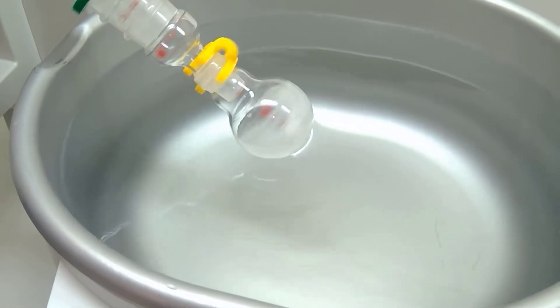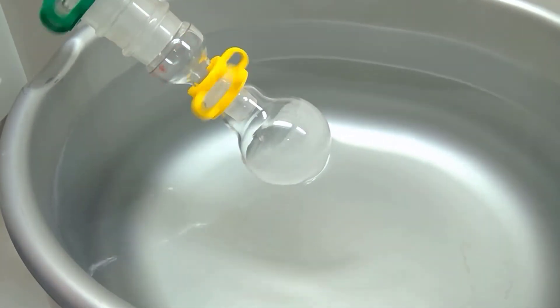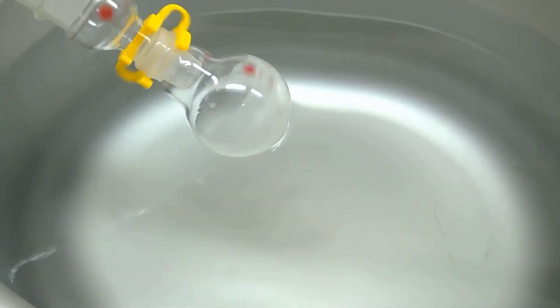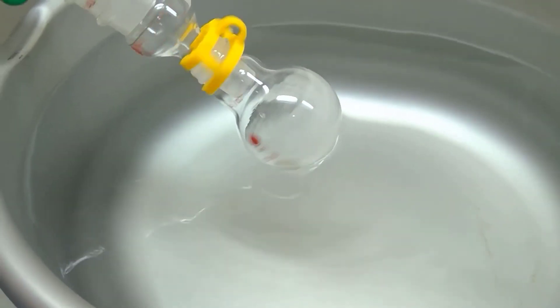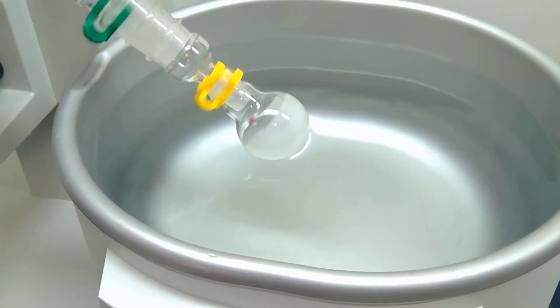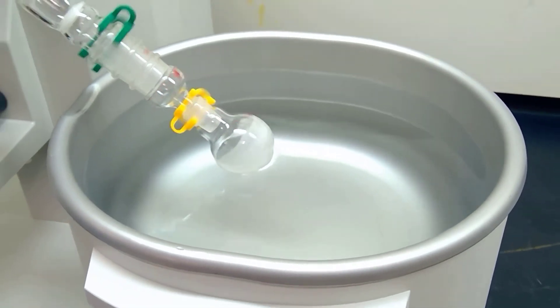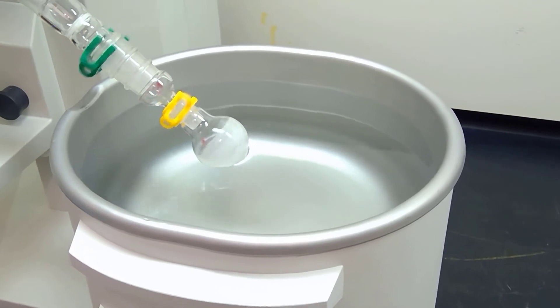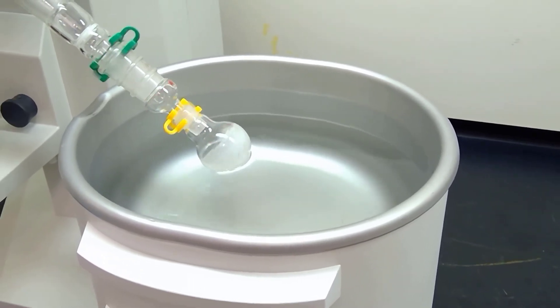We are at the final portion where our solvent is evaporating. If you notice, we do have solid forming on the inside of the glass. Phenacetin is somewhat of a shiny compound relative to the solid acetaminophen, so I can tell we have generated some product here.